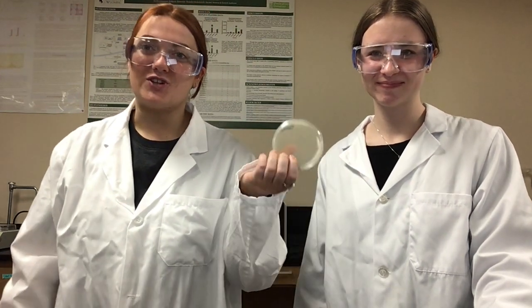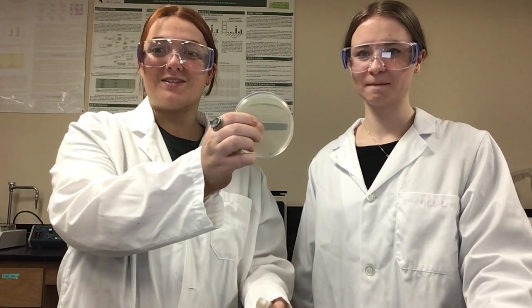This is a TSA plate, otherwise known as tryptic soy agar. This medium is used for general isolation of bacteria, while this plate, Mueller-Hinton, is a media that's commonly used for antibiotic susceptibility testing. Both of these plates are non-selective, which means that most organisms will be able to grow successfully on them. However, given the difference in compositions of these mediums, we may be able to see a difference in results even when inoculating the same species of bacteria.